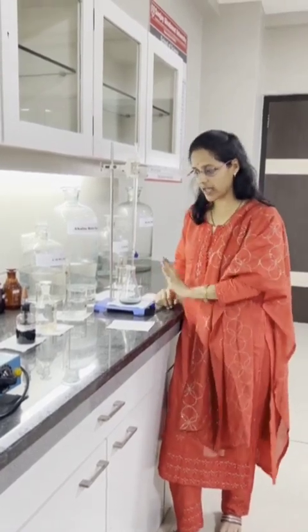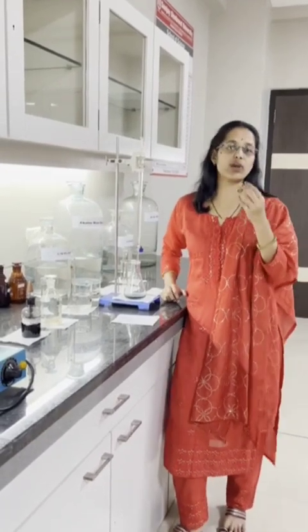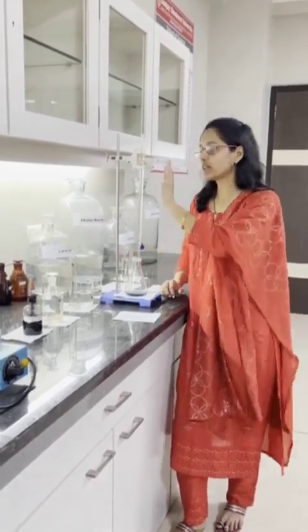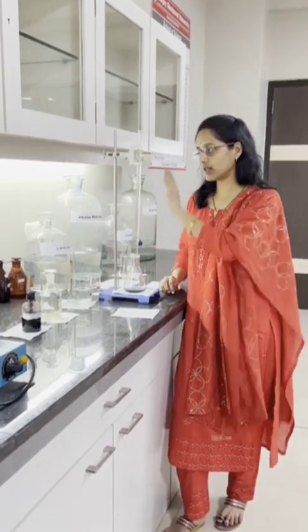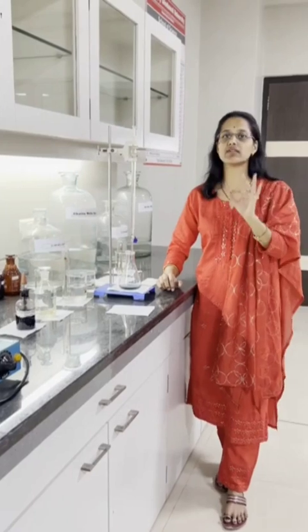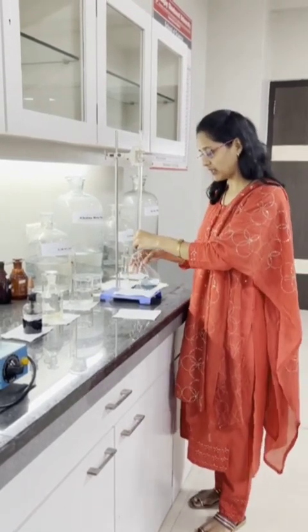Whatever Ca and Mg which may be in the form of carbonate, bicarbonate, chloride, sulfate, or nitrate — all of them react with EDTA and we get the reading. We have to repeat the same process twice to get 3 readings. So this is the total hardness.